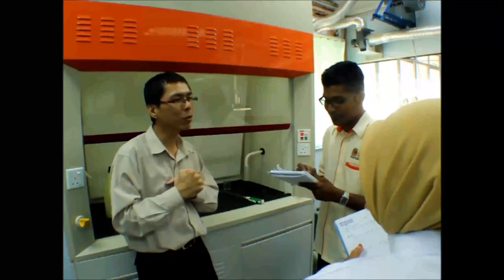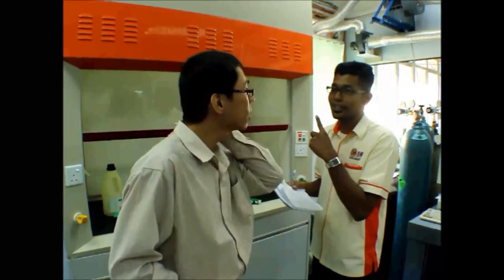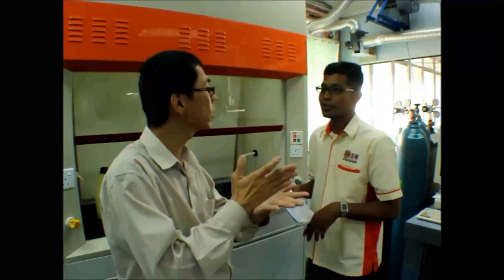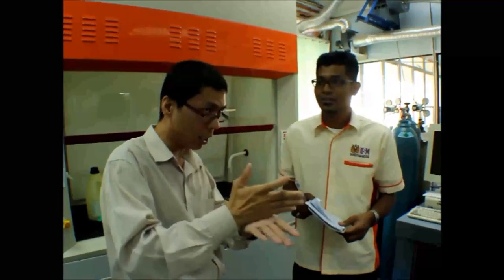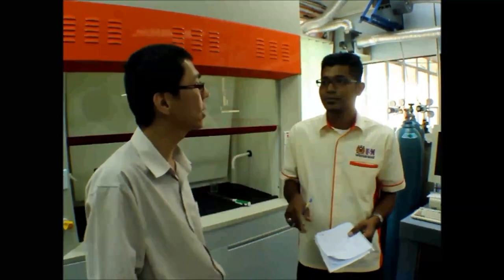Okay, can you do it? Prepare. Series dia apa? 100 boleh, or 50 pun boleh lah. Depends on you. You decide first what you want to do. What you want to dilute first. You nak dilute sampai mana dulu? 1000 to 100. 100 to 10. Then you dilute, can prepare 2 ke 1 ke. Boleh. Then you need a lot of volumetric flasks.